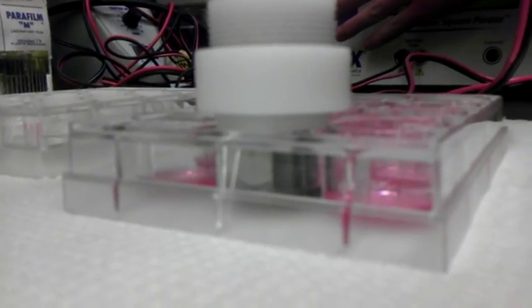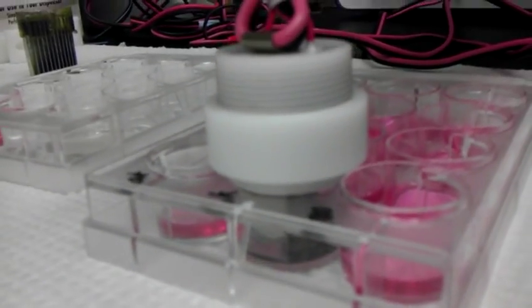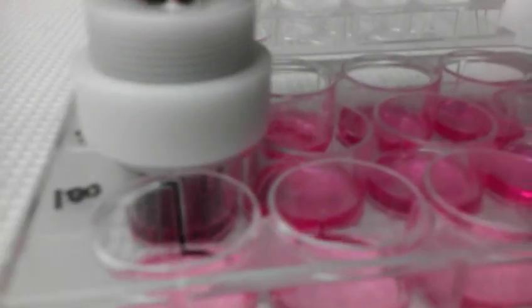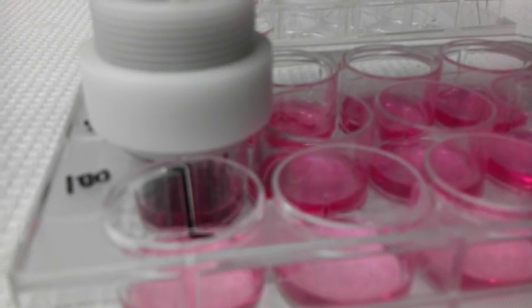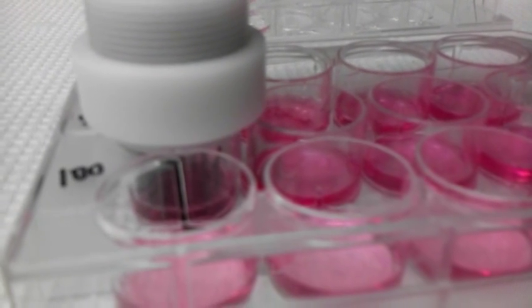And then push down there. Now get close to here so you guys can see this. You want to see it from the side angle or from above? Yeah, see it from the side angle. We can't really see the liquid very well. If you look from this angle, it's a pretty clear view. From this angle, it's kind of clear. From there? Up. Just a little bit. Up, like that? There you go. Okay. Yeah, get in there. Okay, ready? Watch this. See the bubbles form? Yeah.